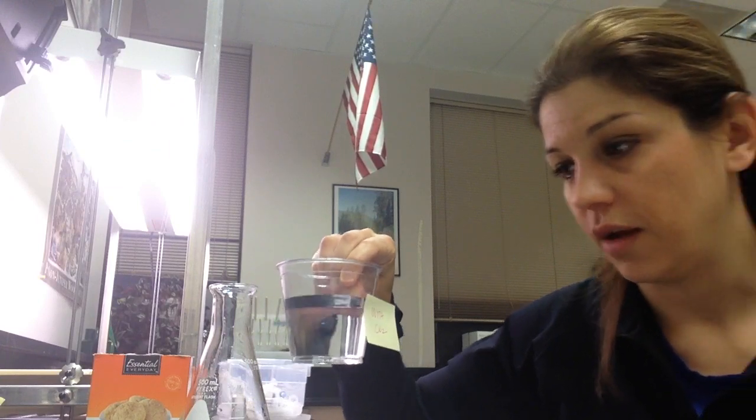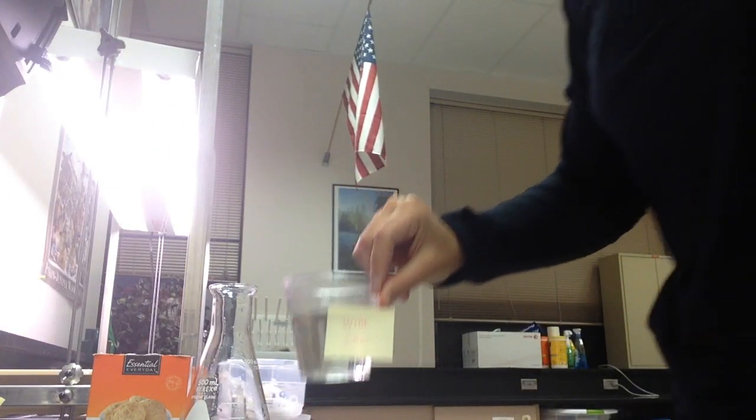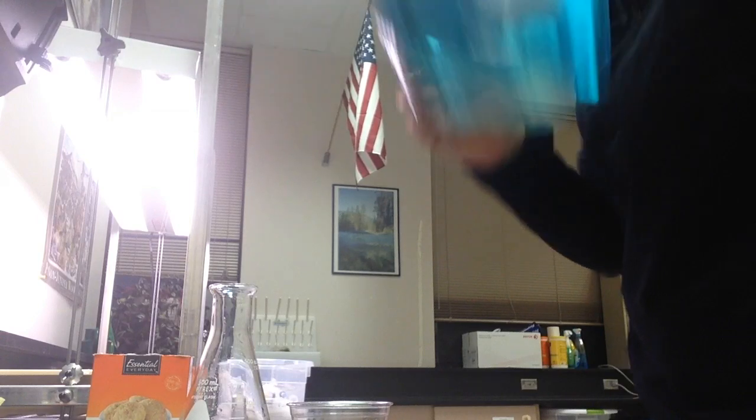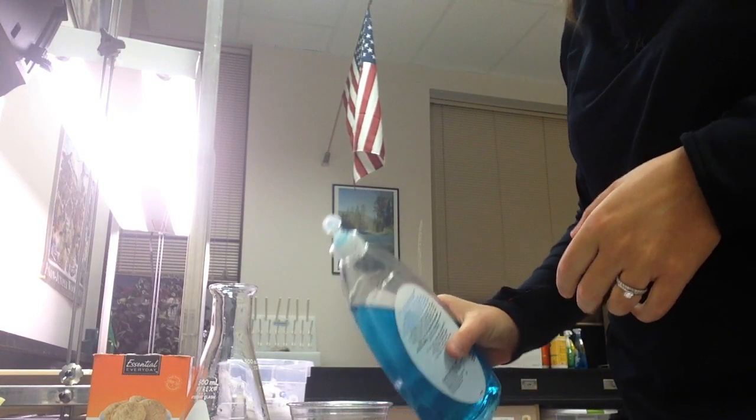With your CO2 cups, I've put my carbonated water in here. It doesn't look carbonated. Usually carbonated means CO2 gas like in sodas, but we don't want visible gas in here because we're using gas production to indicate photosynthesis. So you put your carbonated water in, then you're going to add a drop of very dilute Dawn soap — just one or two drops.